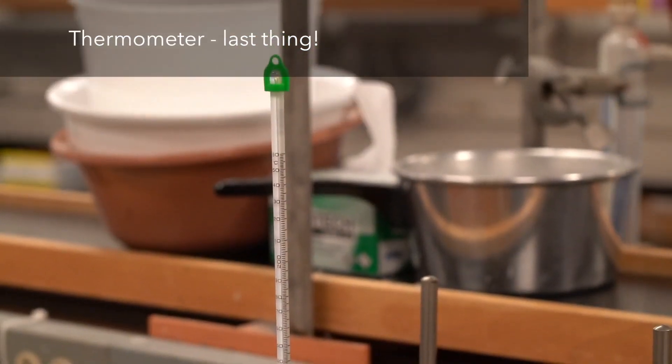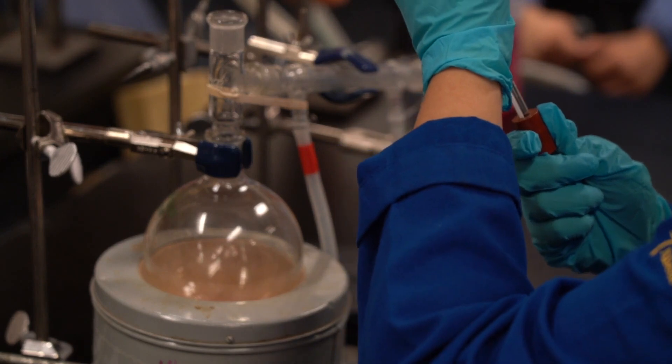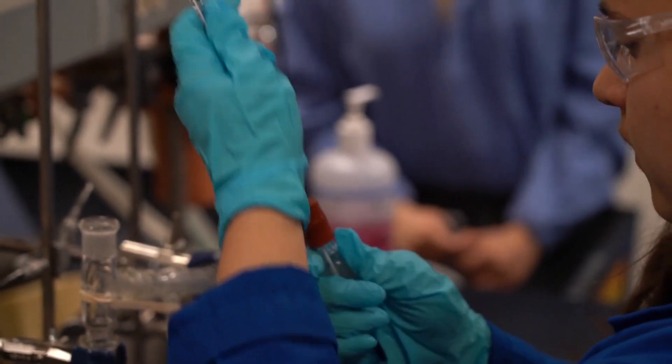So just take the adapter off rather than pushing it down. And then hold it nice and close. I wet the thermometer by the way, so that's like a little lubricant. Don't use grease on the thermometer. You can just use a little water.